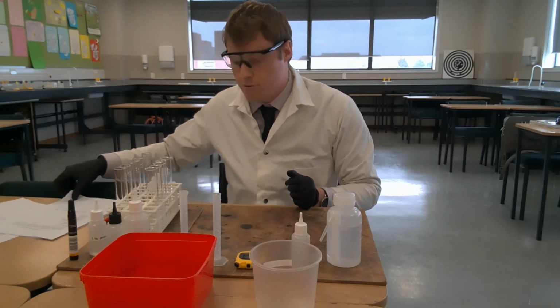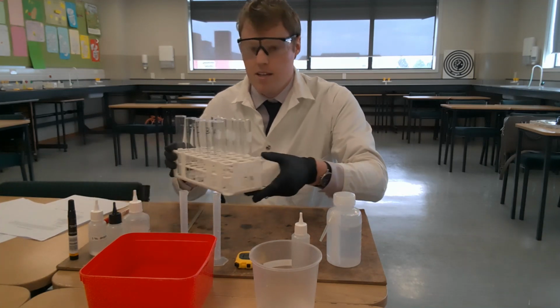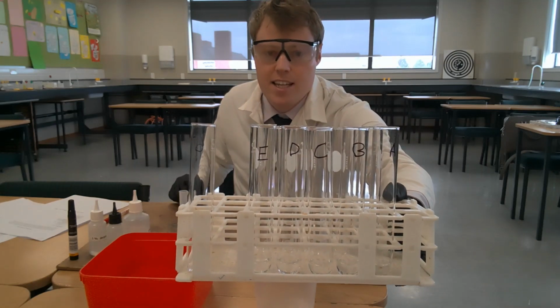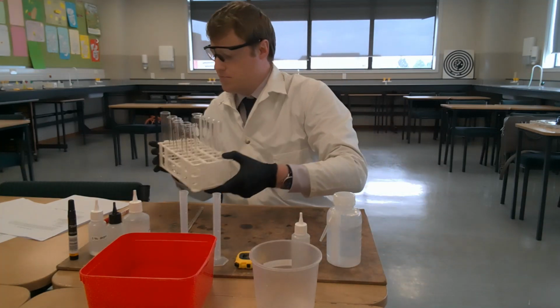I just want to start by running you through the equipment list and showing you that we've got all of the equipment here. So we've got 6 boiling tubes. If I just hold this up, I have pre-labelled them. You can kind of see that on the video. I've pre-labelled them A to E, and I've got boiling tube 6 there as well.